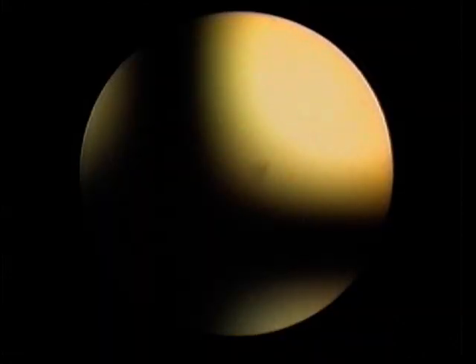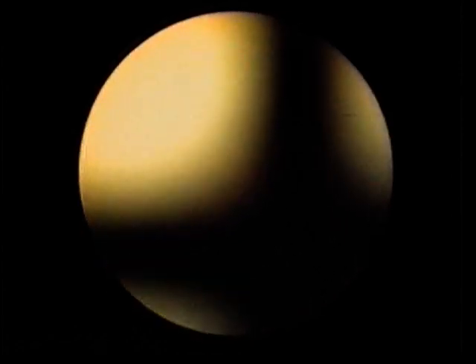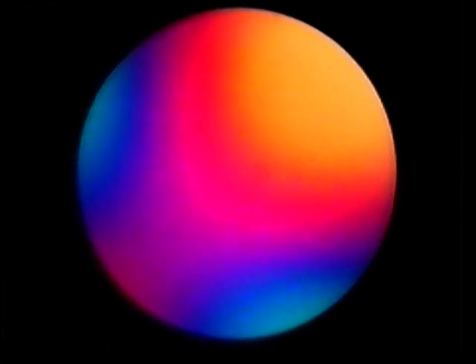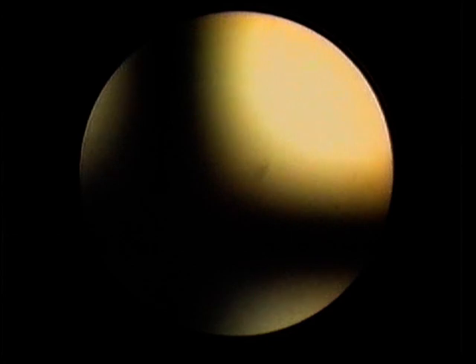Here's a conventional, slightly off-centred figure. The isogyres remain east-west and north-south during stage rotation. Try to keep track of where the centre of the cross is during rotation. Determination of optic sign is easy as the quadrants are easy to recognise. Here there's a fall in the northeast, therefore optically negative.